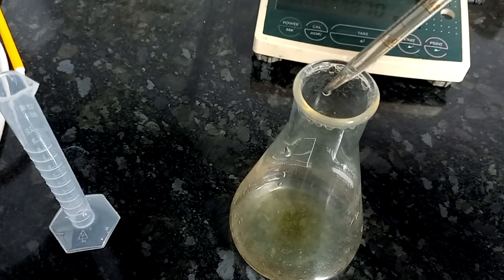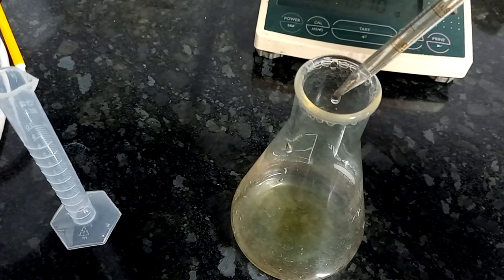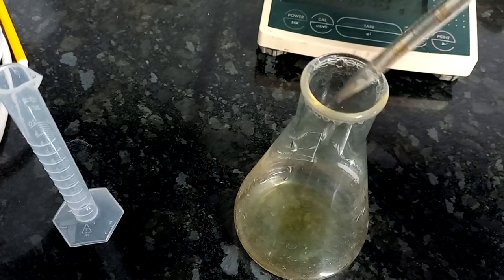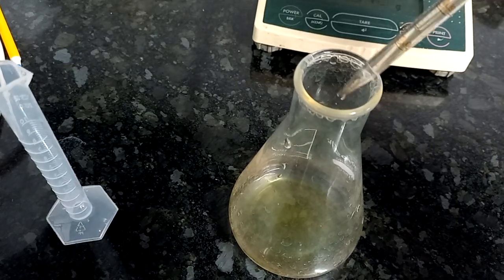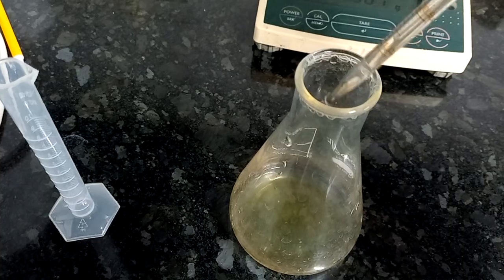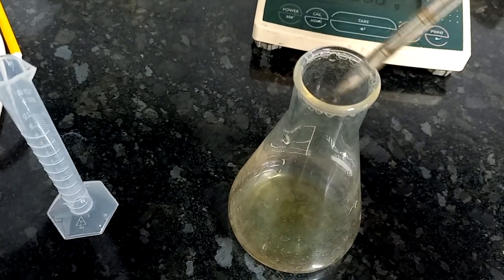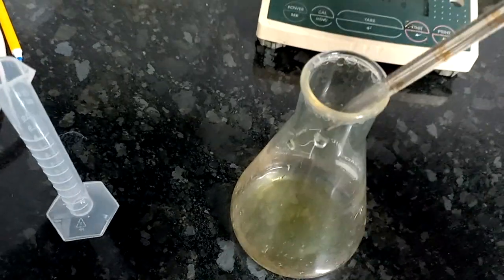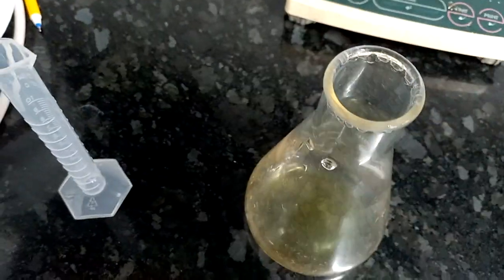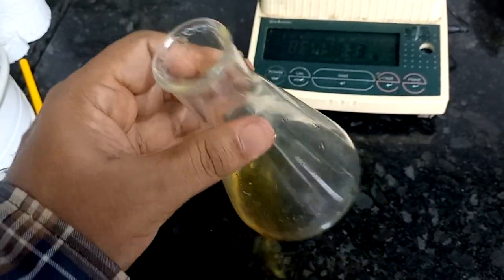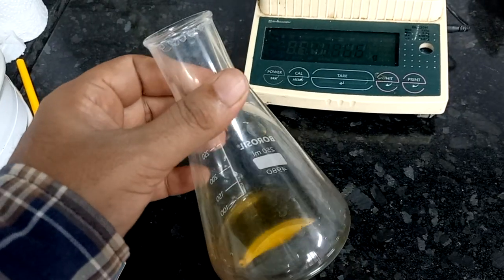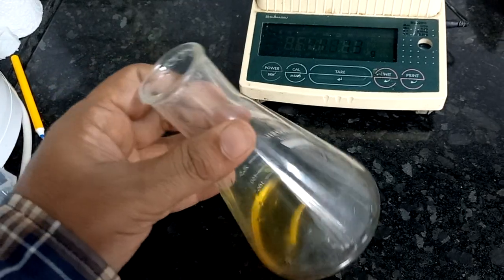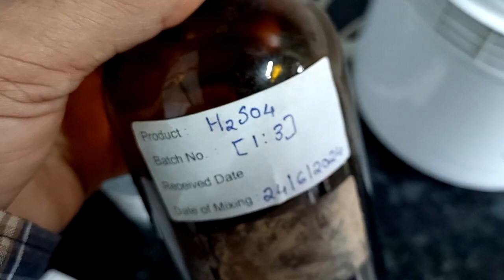Mix well and keep this solution for 30 minutes. After 30 minutes we can continue the analysis.